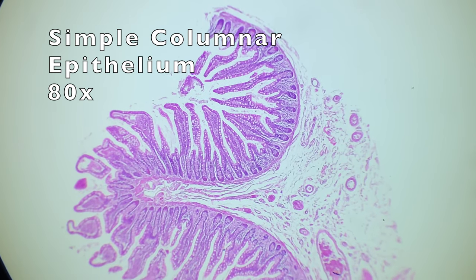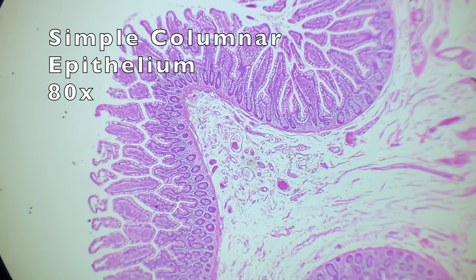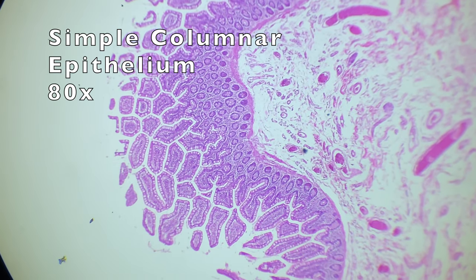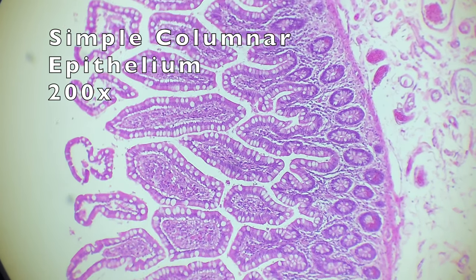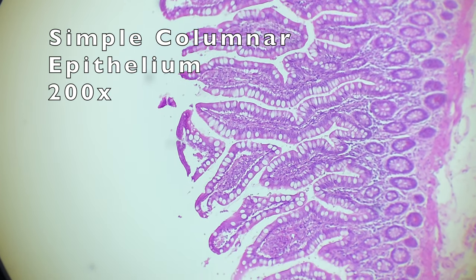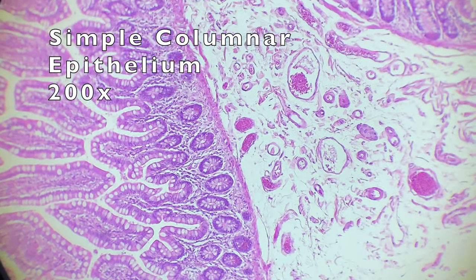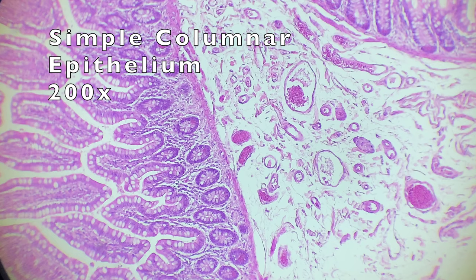Now here we have simple columnar epithelium — the column-shaped cells, similar to what we saw earlier in the kidney. I believe what we are looking at here is a section of small intestine, but this might as well just be a piece of art — I would hang a picture of this on my wall. Zooming in closer, the columnar epithelium cells most of which contain a sort of white circle inside of them — absorb material. To the right of the columnar epithelial tissue it's very rich with blood vessels.